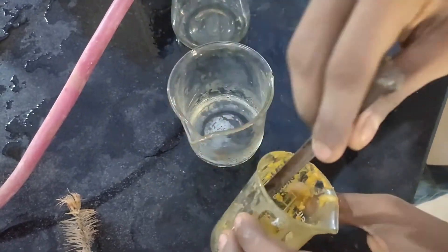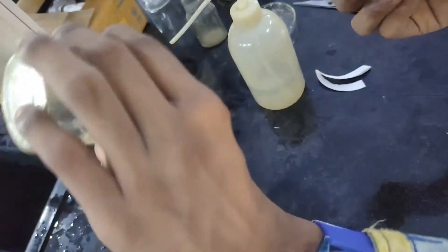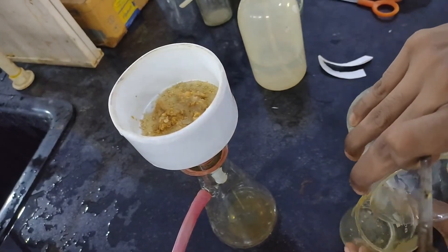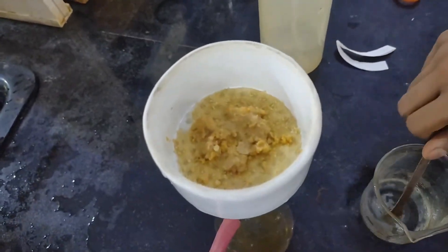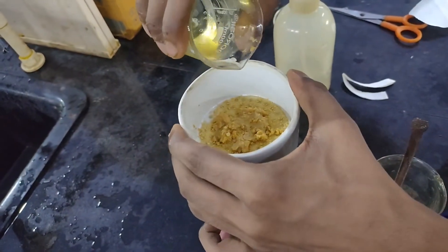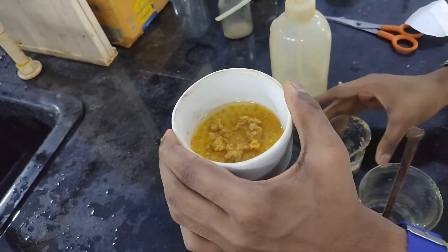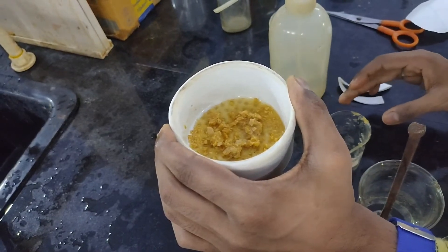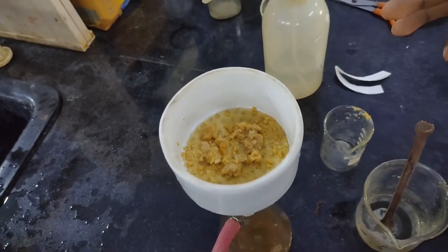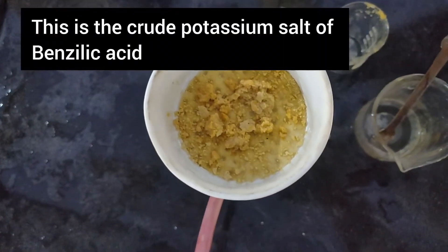This was filtered through a Buchner funnel and then washed with some cold water. However, I feel like cold ethanol should have been used. Due to water washing, my yield was low. So this is the crude potassium salt of benzilic acid.